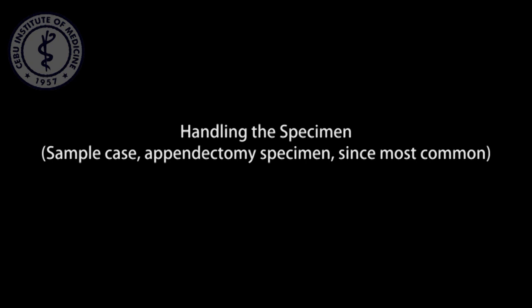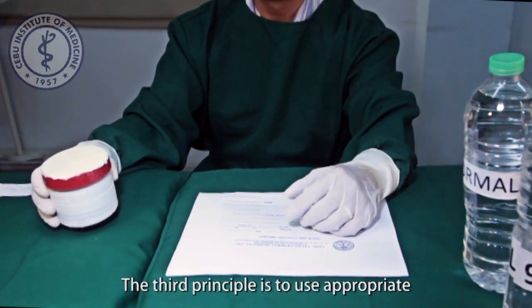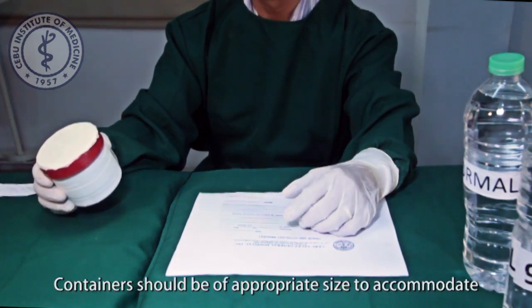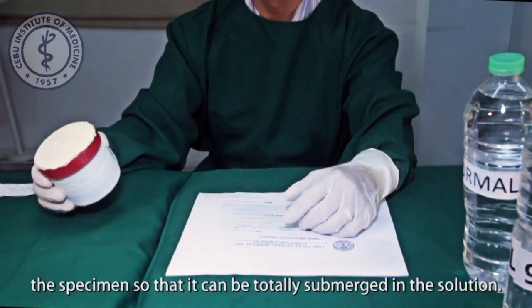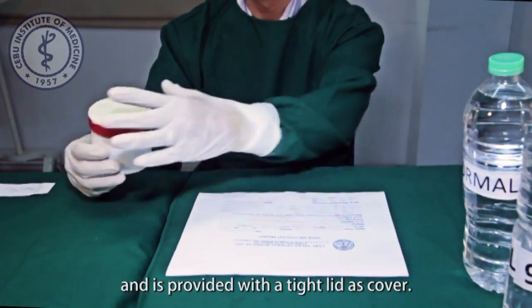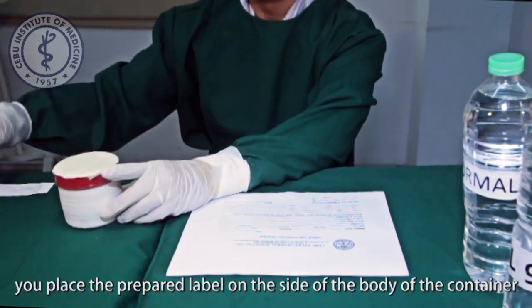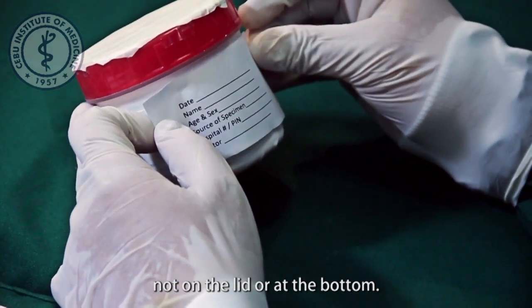Handling the specimen. Once the operation is done, you prepare the specimen for transport. The third principle is to use appropriate containers and solutions. Containers should be of appropriate size to accommodate the specimen so that it can be totally submerged in the solution. Preferably, the container must not be transparent and is provided with a tight lid as cover. Once you have selected the appropriate container, you place the prepared label to the side of the body of the container, not on the lid or in the bottom.